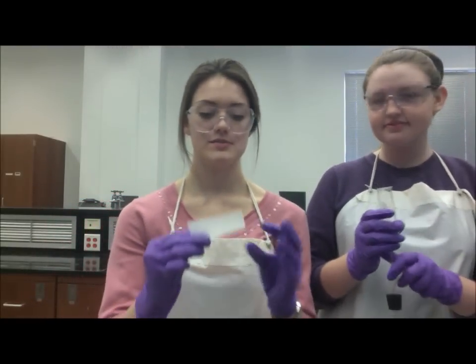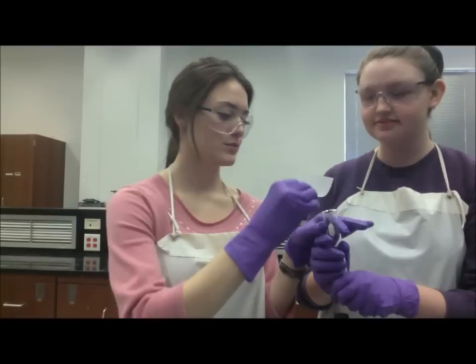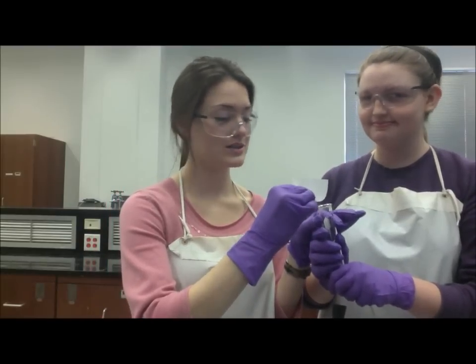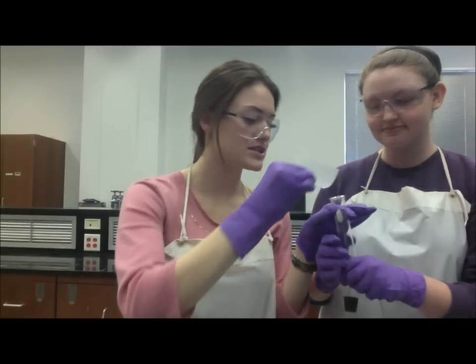Now that you have the safety out of the way, measure out 0.14 grams of magnesium turnings onto weighing paper. We're not going to show you because you should already know how to do this, and then put them into your test tube.